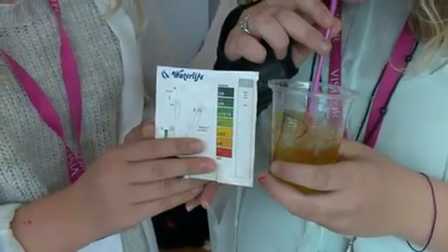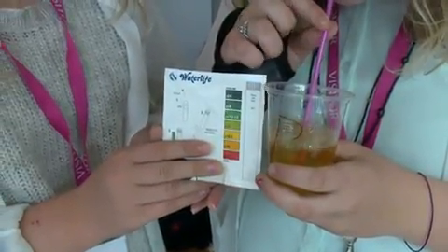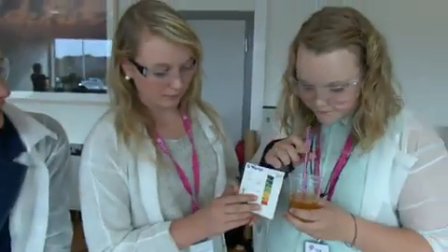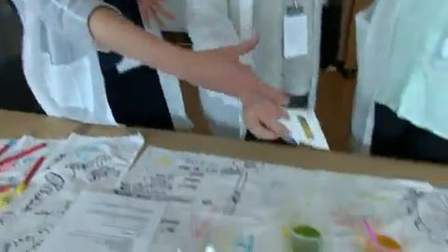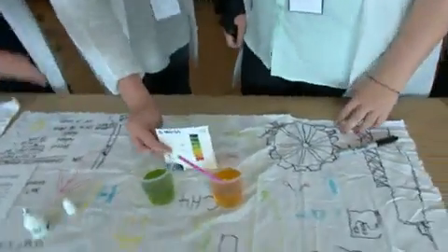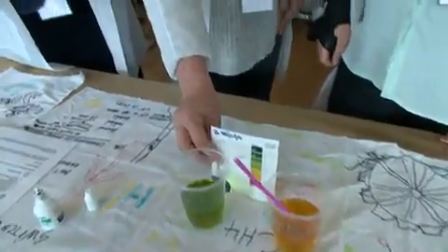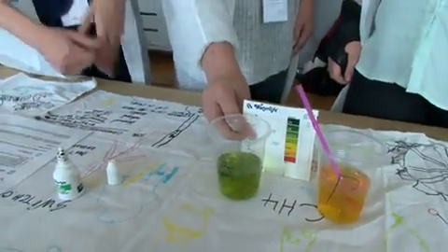Excellent. Okay, Yvonne, what colour has that turned? Number six. And number six is an acid. So that shows us now that the carbon dioxide mixed with the water turns to an acid. Thanks, girls.